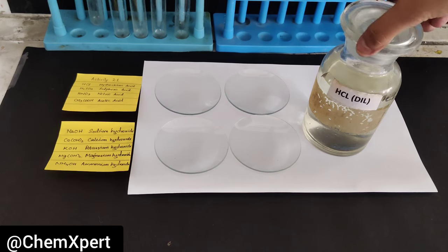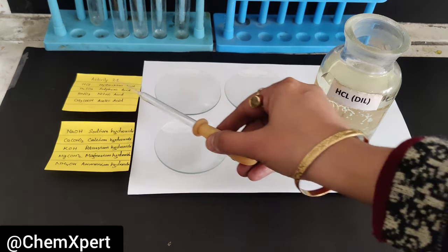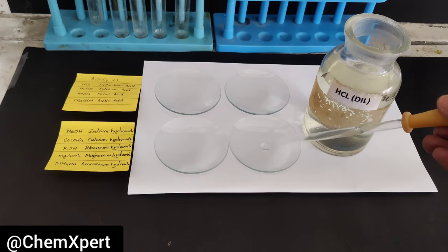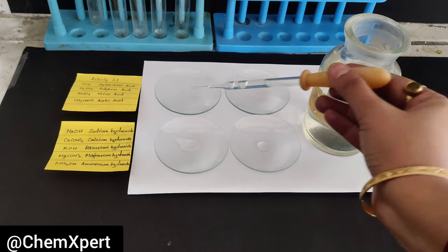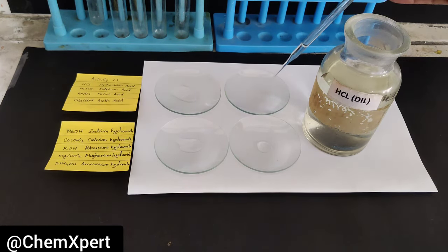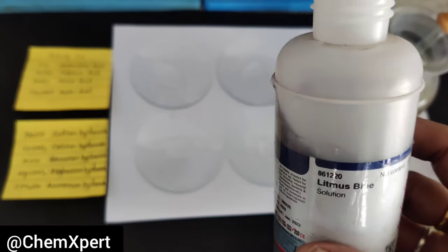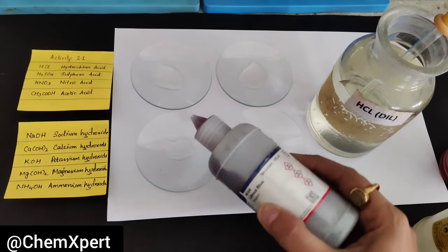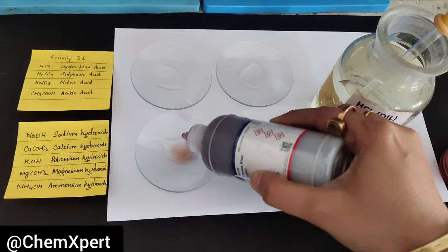Now the next step is to take 4 watch glasses. I will add a drop of hydrochloric acid on each watch glass. Then I add the indicators. First, I add blue litmus over one watch glass, and you can observe it turns red in color.